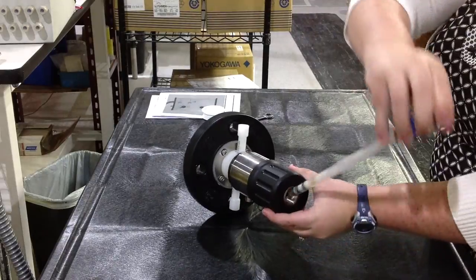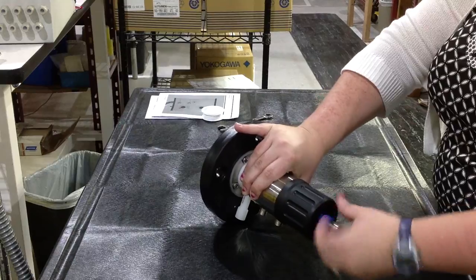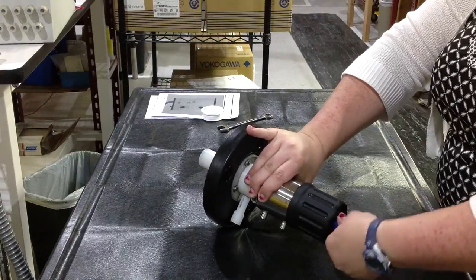All you simply do is install the sensor into the retractable holder, and you have to install it all the way. If you try to retract it or put it back into service mode, it will not work if you don't have a sensor in there.